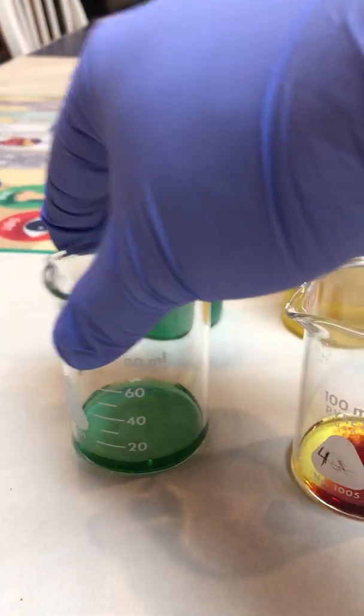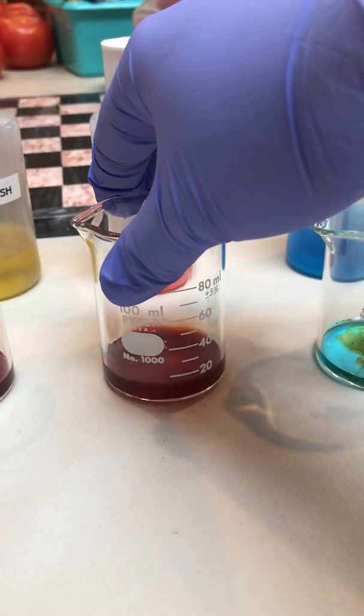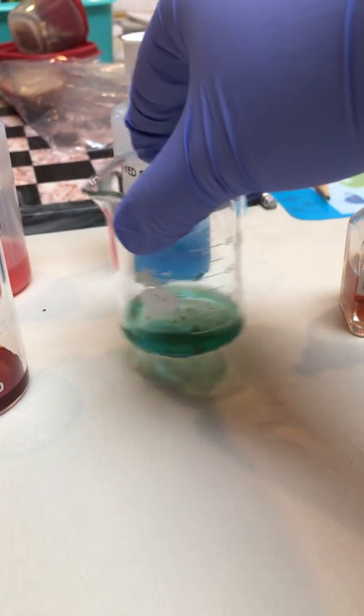So you want to swirl these around a bit, just to mix. You notice we've started to see a color change already with two of our medications.